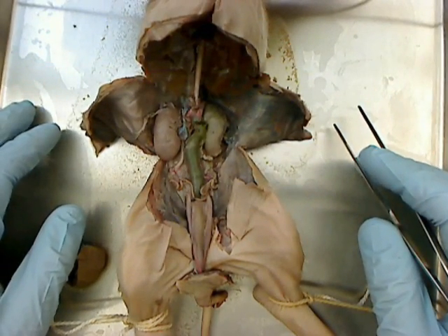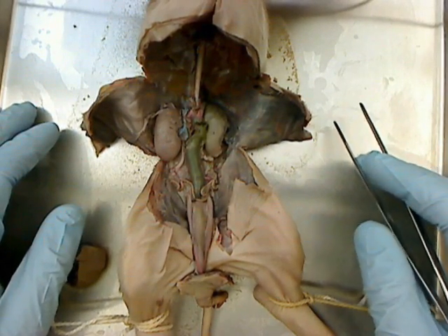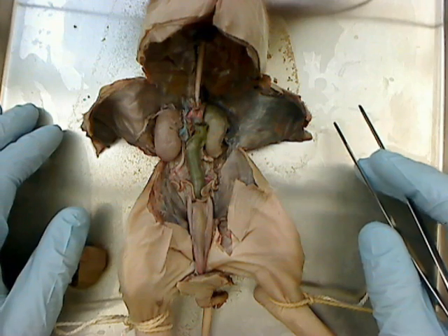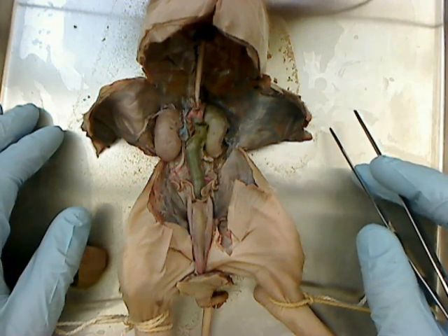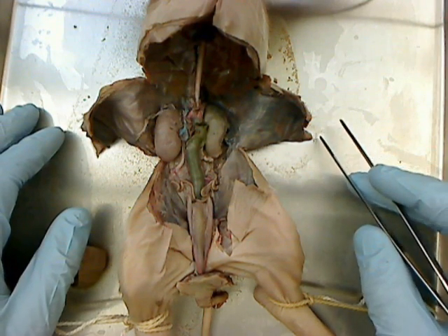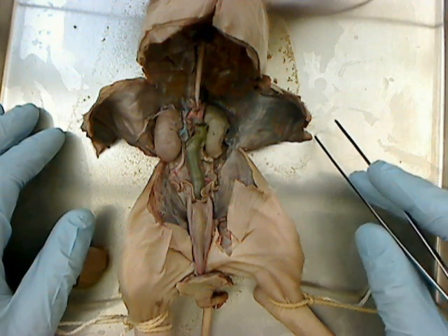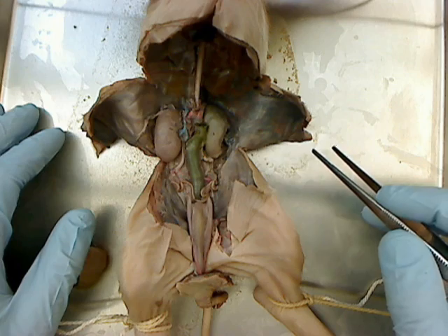Welcome once again to Anatomy and Physiology at Glen Oaks Community College. I'm Dr. Ren Hartung. For this video, we're going to look at the urinary system and the reproductive system of a fetal pig.